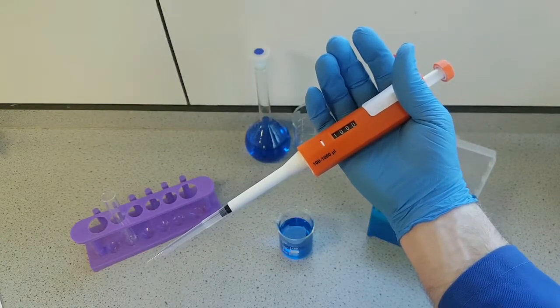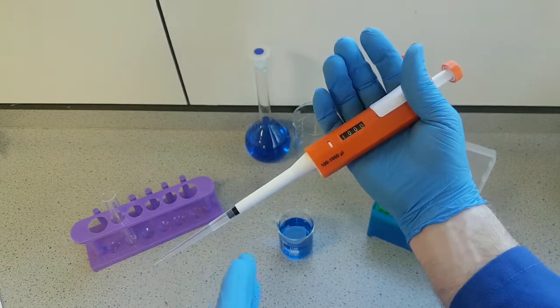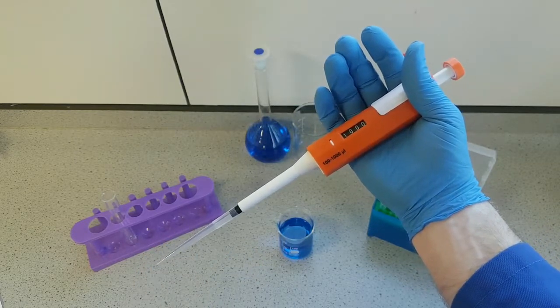If you're sampling from the same sample, then you can keep the pipette tip on, but if you change samples, then you'll need to change your pipette tip each time.